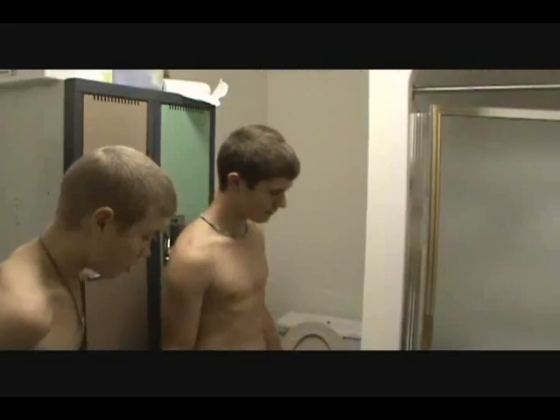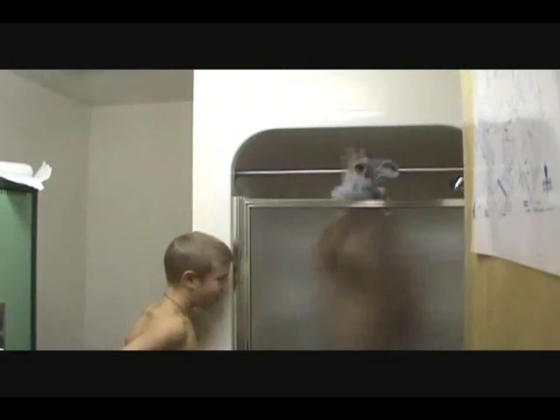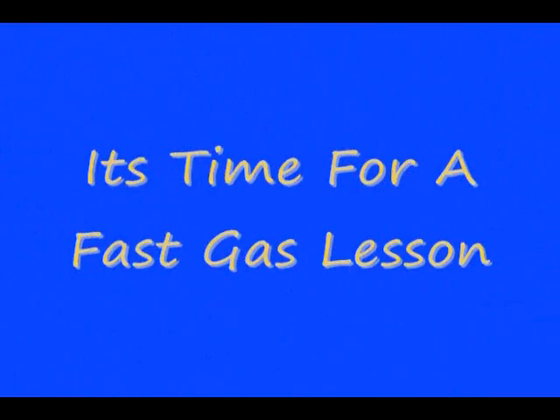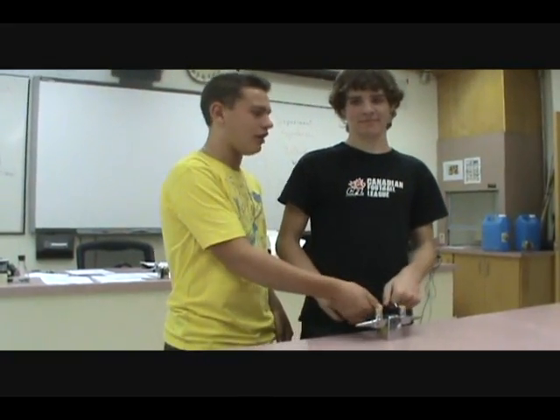God, what happened? I'll give you a hand in there. Whoa. Always keep these at 45 degree angles. And do not let any other gases out either.